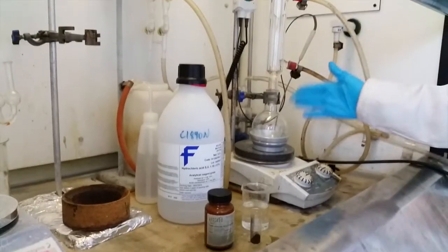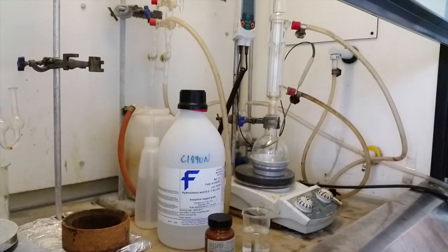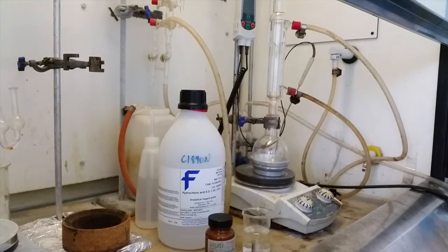You will also need a reaction setup consisting of a 250ml round-bottom flask, a water condenser, a stirrer hot plate and aluminium heating mantle.